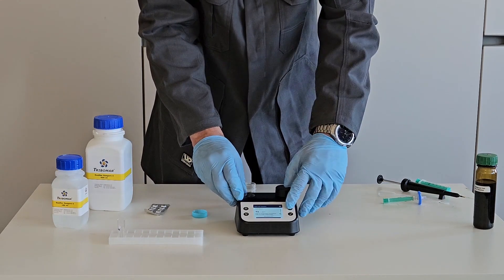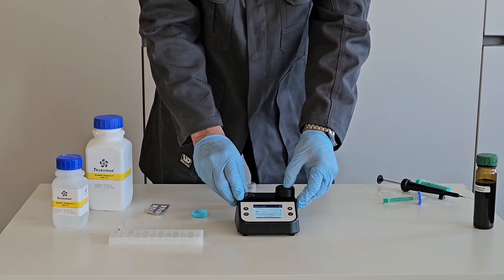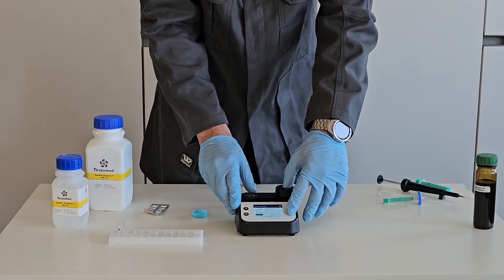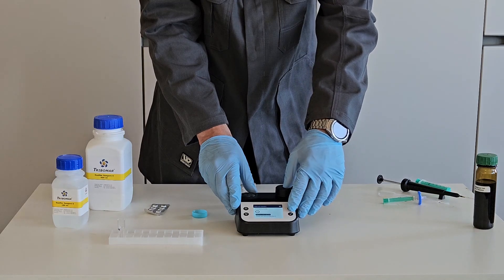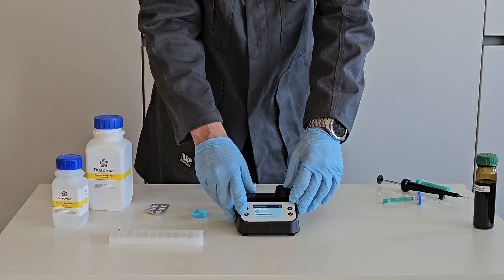It can be repeated or directly stored under correct fill cylinder. Very important, the used cuvette, syringe, and filter need to be disposed. No reuse is possible, else next sample would be contaminated with iron content. Afterwards, next sample can be tested.